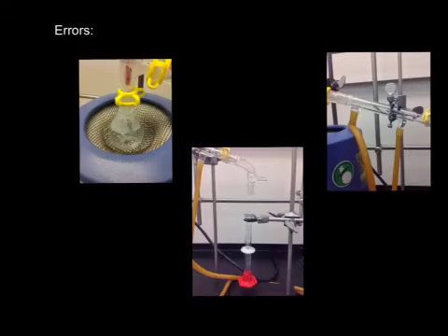In the experiment, there were multiple areas where the student had the potential to make errors. The student could have ended the fractional distillation too soon, before fully collecting all the ethanol within the mixture, allowing it to evaporate, leaving only the water there and allowing the boiling point of water to be reached. Additionally, the air bubbles within the condenser, as you can see right here, could also influence the amount of ethanol being collected in the distillate.